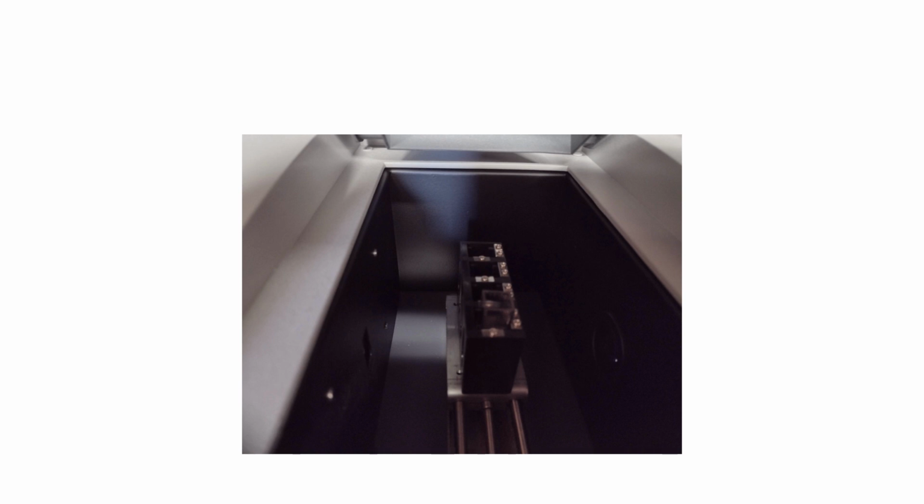Just put your cuvette, which is what the sample holder is called, put it in here, close the lid. Bingo, there's your number. Next sample. Bingo, there's your number. You don't have all of that time making the media, incubating it, counting the colonies, now having to sterilize all the waste, etc. So the advantage is ultimately it's going to be much faster.